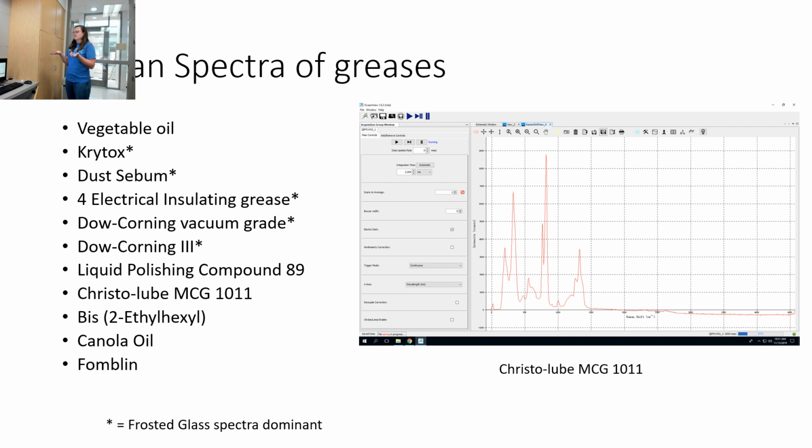In this case, they all did actually have independent spectra, which is quite nice, because I used a glass vial instead of a slide. The only problem I ran into with the Bis (2-ethylhexyl) and the canola oil is that I couldn't get the baseline to be flat. I would change the integration time, and take 2 or 3 dark spectra to blank, just to make sure, and every single time it wouldn't be on the baseline. There'd be peaks, but it wouldn't be on the baseline. I put the 3 that were giving me issues in the Word document.